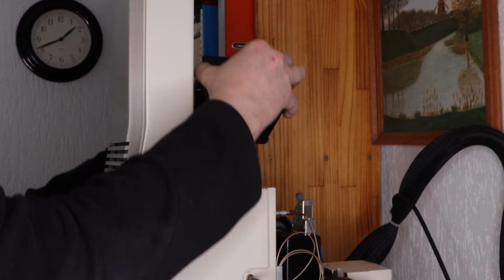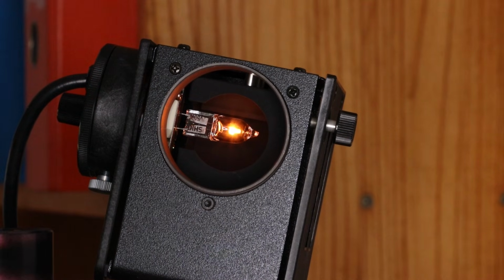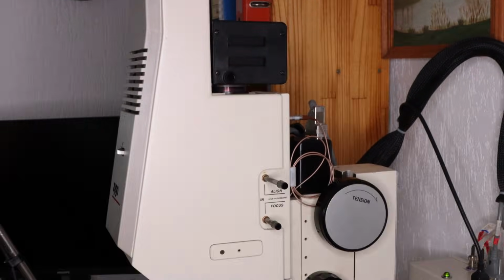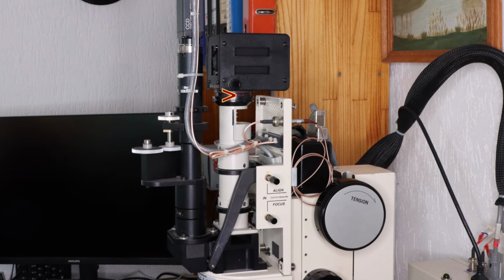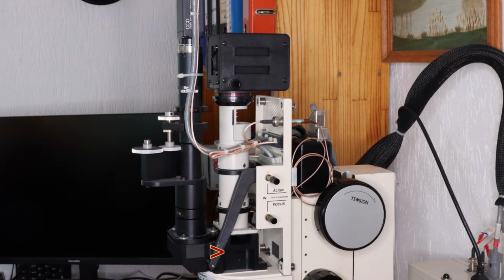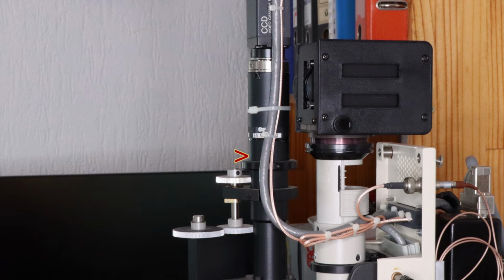The light source itself is an ordinary incandescent lamp, which looks as if it contains quite a bit of infrared, which is actually an advantage because the broader the spectrum, the narrower the coherence pattern. Let's remove the cover and take a quick peek inside at the configuration. The light from the lamp is made spatially coherent using the optical assembly contained in this tube here. The spatially coherent light then goes straight through a beam splitter and then into the microscope objective where the interference is generated. It then returns to the beam splitter and is reflected to a camera. And the camera has a zoom lens that allows for setting an additional image magnification.